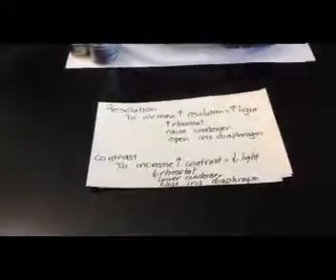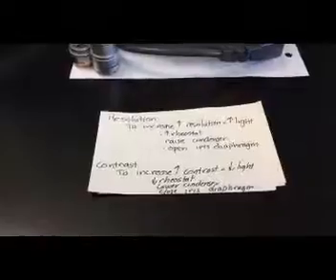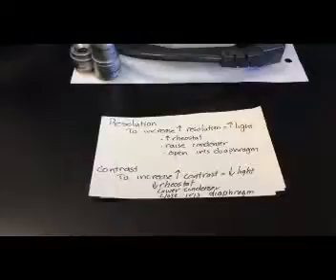And so when we are looking at bacteria, and bacteria are very small, the average bacterium maybe 1 to 2 or 3 micrometers. Because they are so small, what we often do is stain them to increase contrast, and then we look at our stained bacteria with our microscope. So we don't worry about contrast once we stain our bacteria. But what we are concerned about is resolution. So when we're working with our stained bacterial smears, we want to increase resolution.